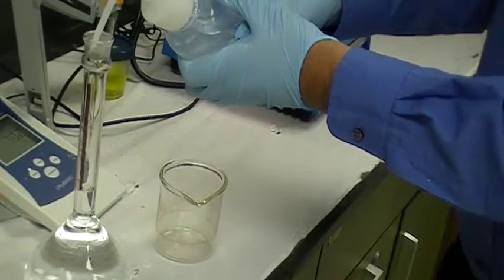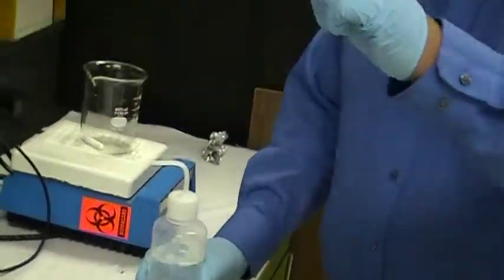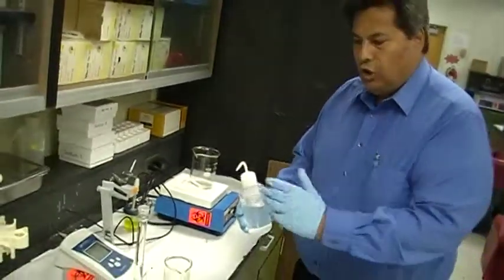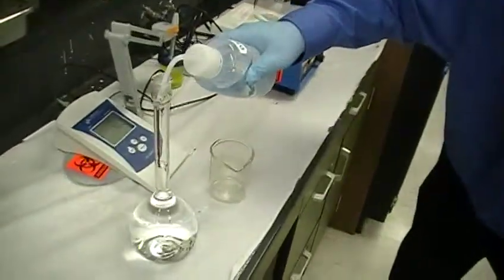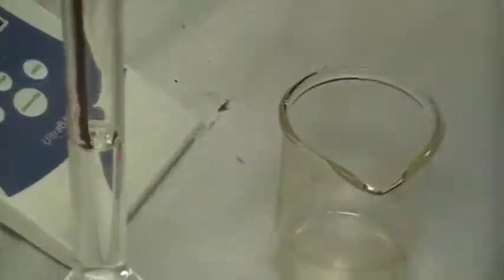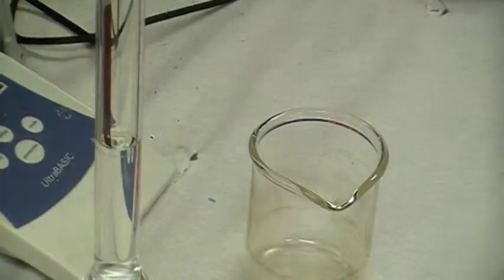And then you kind of slow down the closer you are to the mark. And the rule is that the bottom of the meniscus, the U-shaped bubble above the water level, should be even with the mark for 500 mil. Like that. That's exactly 500 mils.